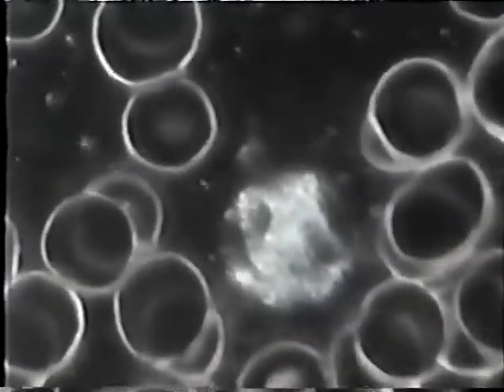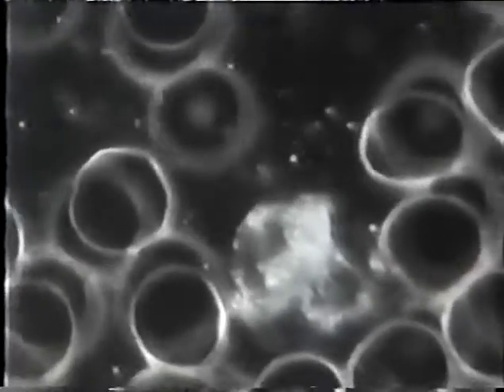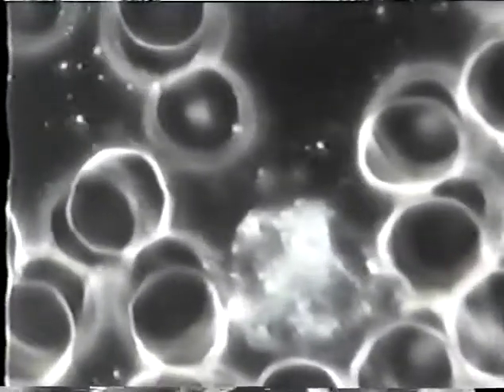This is a white blood cell in live time. And this is some of the influences that the device produces on white blood cells. It increases their motility as well as their phagocytic ability. At the moment, although it may be a little hard to see, it's actually engulfing a particle here at the bottom of the screen. A little black round particle just swallowed. And it's going to go down a little bit and do this again.